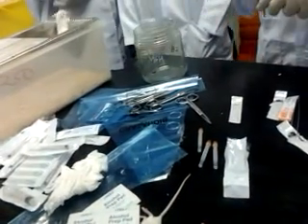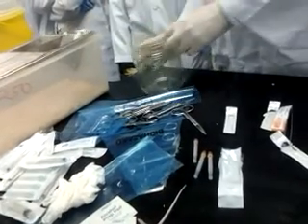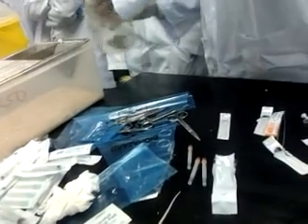I'm going to show you IV. This one will be IV. Give it here. Okay, make sure you don't fall. Maybe you leave it inside there, or else I have to leave it inside here. Still alive. So you can observe.